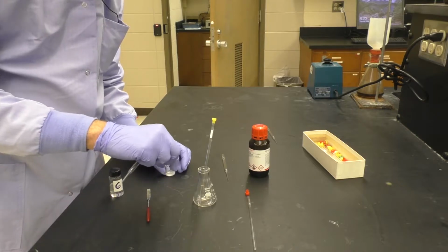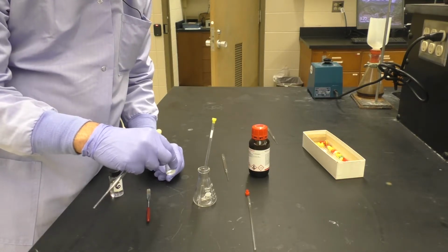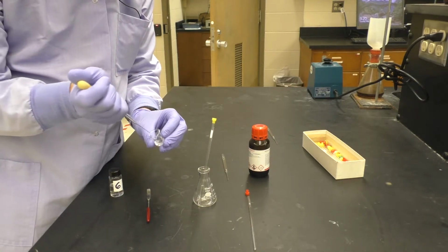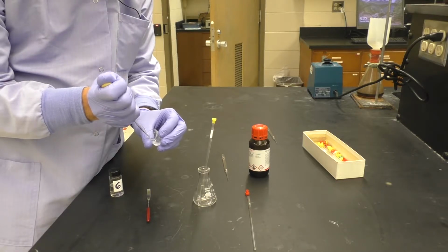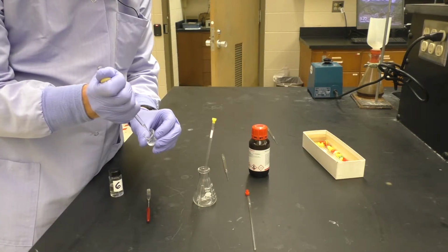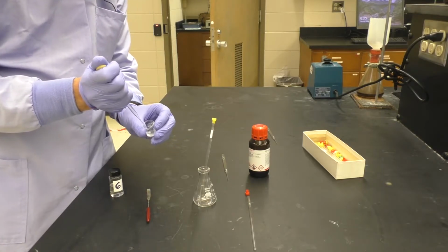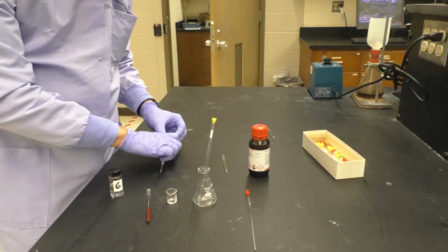Swirl the beaker around to make sure that everything, or as much as possible, is dissolved. Another trick I can use is to suck up material and squirt it back down a few times. We'll want to get as much as possible dissolved. If we cannot get everything dissolved, then one thing that we can do is make use of what's known as a pipette filter.